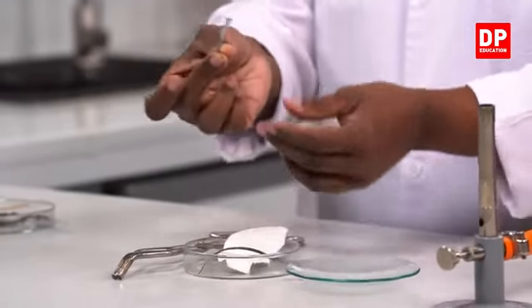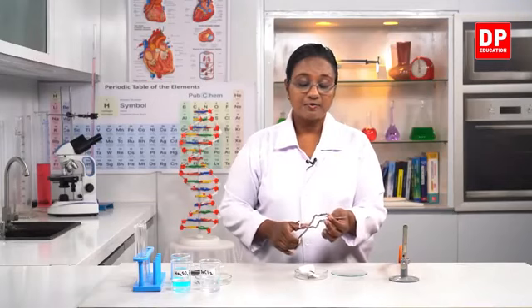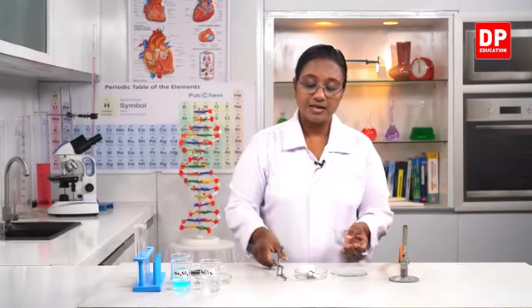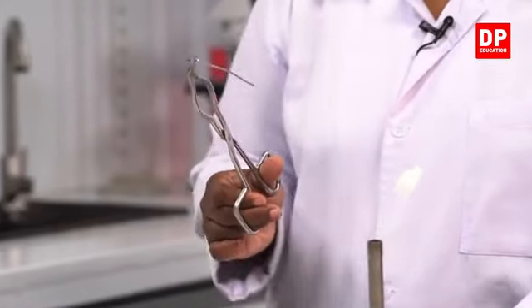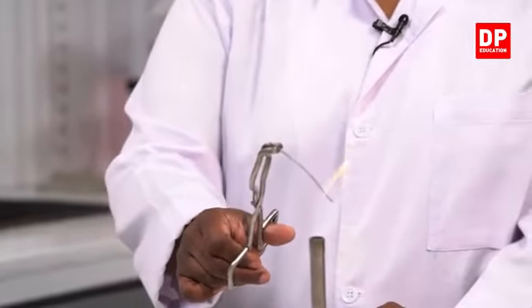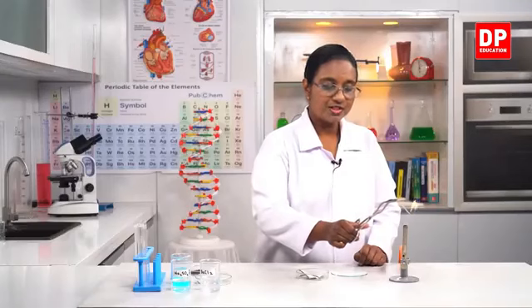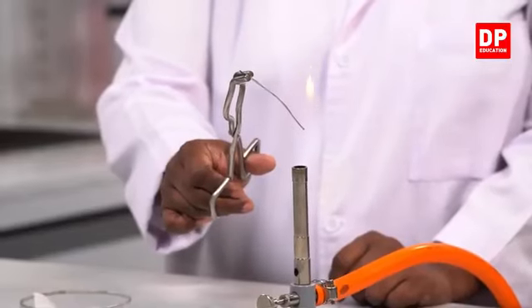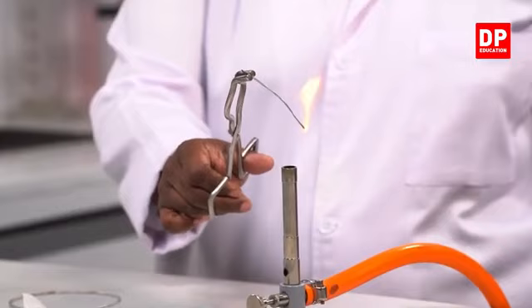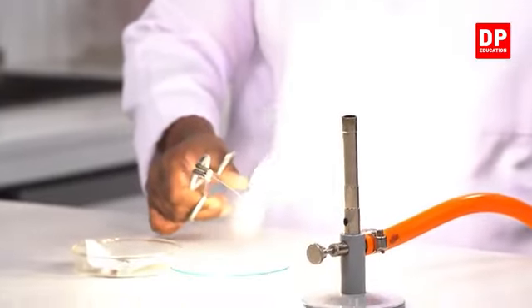So I'm going to use this and burn it in the Bunsen flame. So we need a pair of tongs and then I will burn it in the Bunsen flame. Here I'll take the magnesium strip like before. We will burn it in the Bunsen flame. You all know the observation, students. It burns with a bright white flame. And what do we get at the end? A white color powder. So here you all can see there.